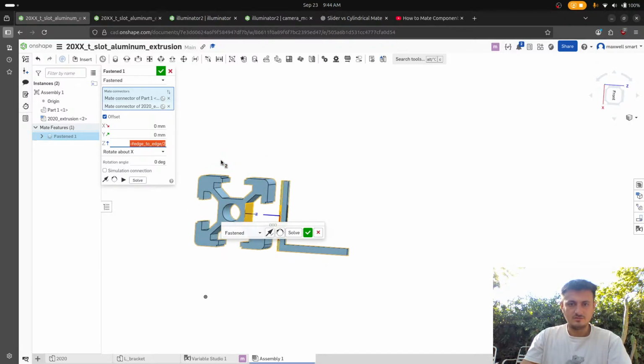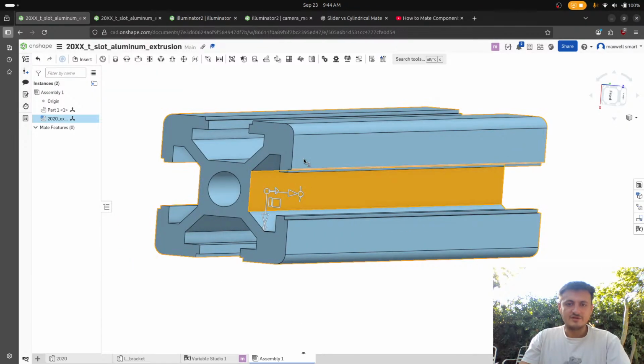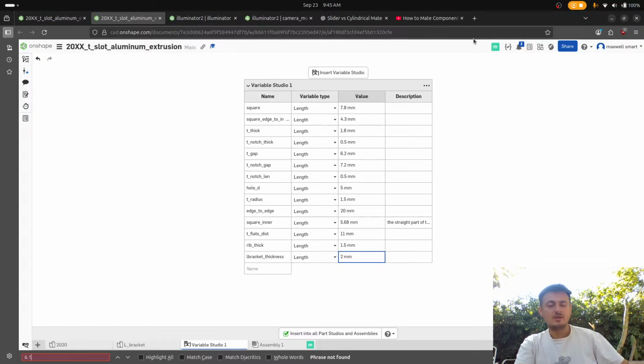Oh, what? Oh, yeah, because that's not right. That's not what I want. But we actually have this measurement. It's the 6.1. Wait, there's no 6.1. Oh, yeah. I gotta go to Amazon.